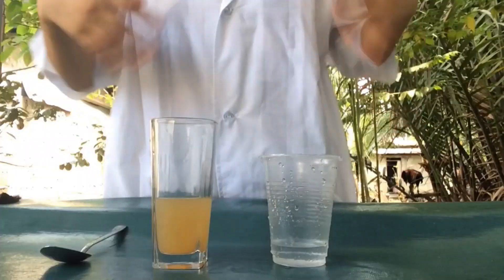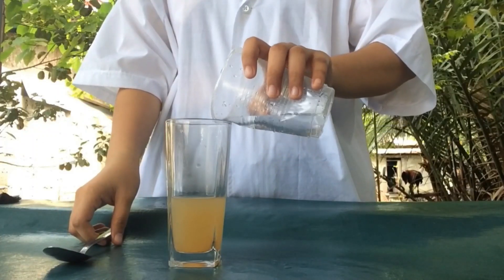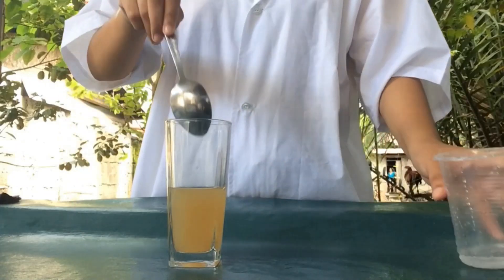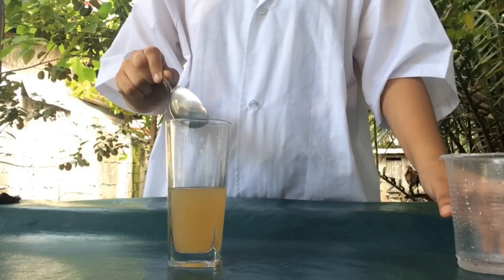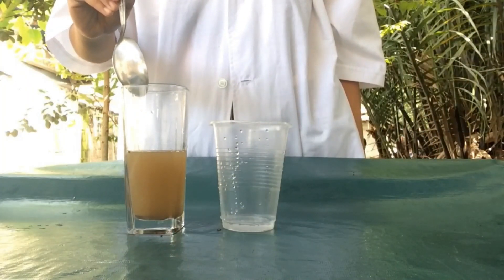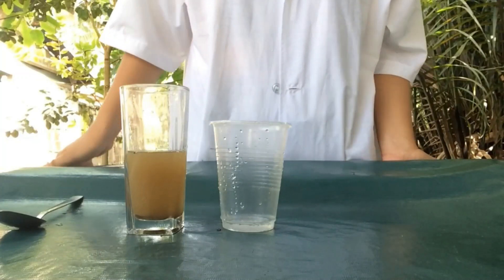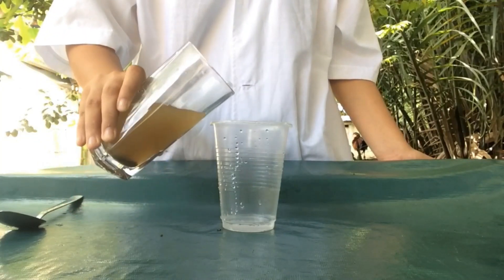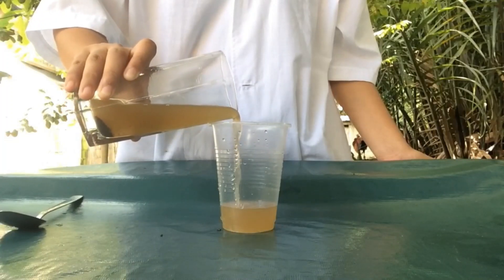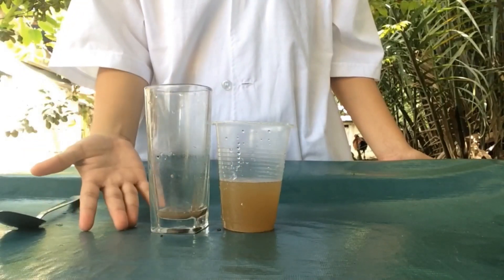The next process is called decantation. In this process, we will be using a spoon, a cup of water, and the filtrate. Simply put the water into the filtrate and mix it up with a spoon. Later on, we will be able to see the precipitate settling at the bottom of the glass. There you can see that we can now easily separate the liquid from the precipitate through the process of decantation.